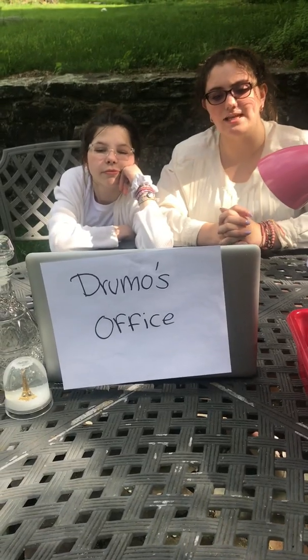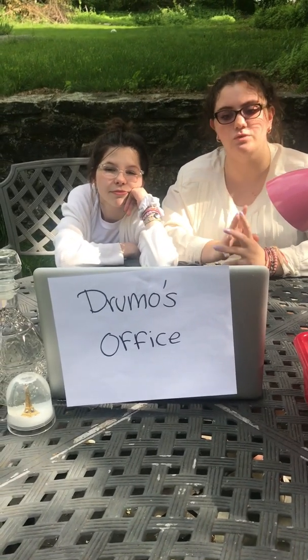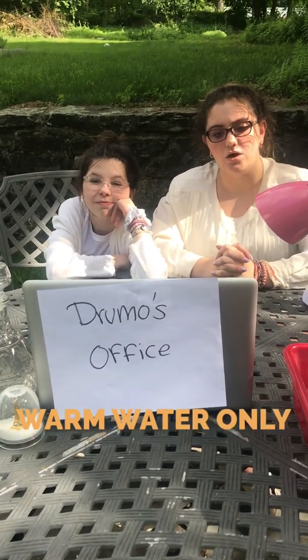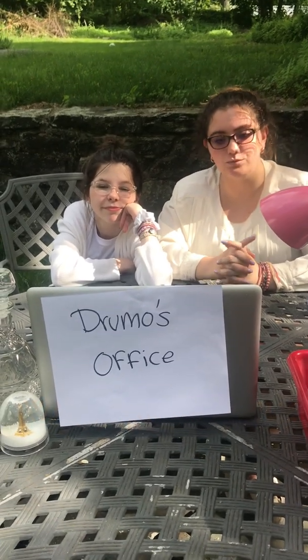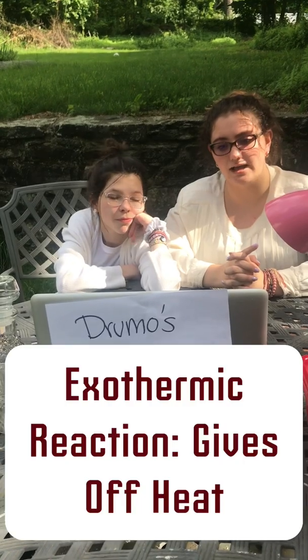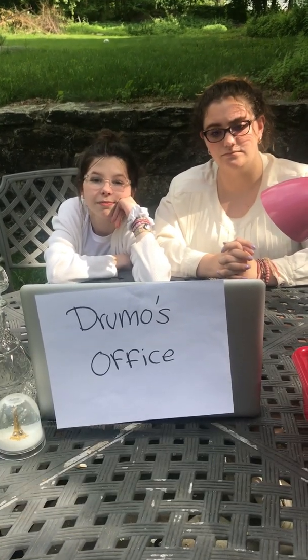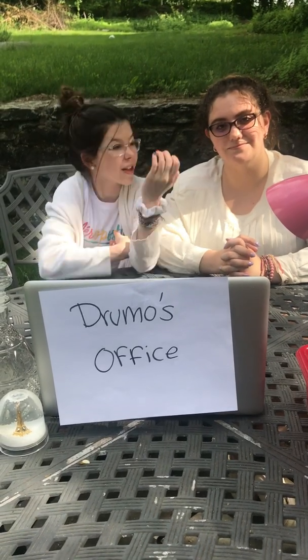Now, when you do this type of experiment, you must remember that you cannot use cold water because you will get no reaction. Or you can't use hot water because it will kill the yeast. Now, this type of reaction is an exothermic reaction, meaning that it gives off heat. So let's go!